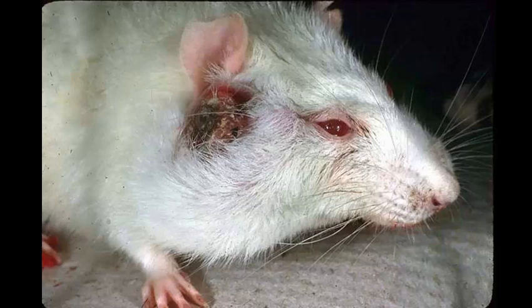Okay, we're back. It's a classic tumor in a classic spot underneath the ear of a rat. This tumor is ulcerated. This is one I certainly would not give you any credit for mammary fibroadenoma, not in this spot right here. This is a classic spot for a Zymbal's gland tumor. Most of them, the vast majority of them, are benign. They never tend to metastasize. They get big, they get ulcerated.